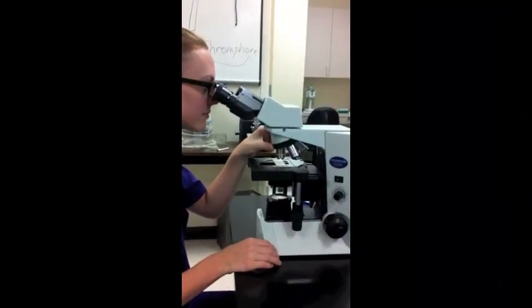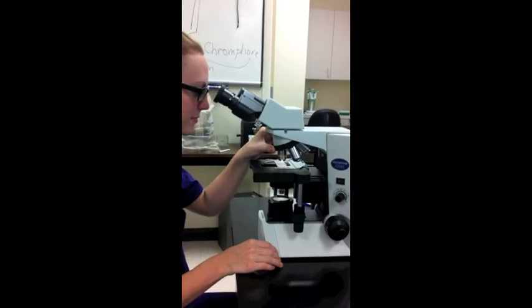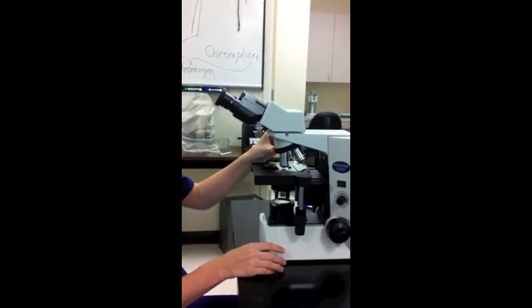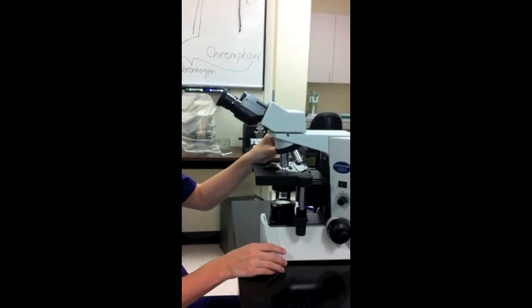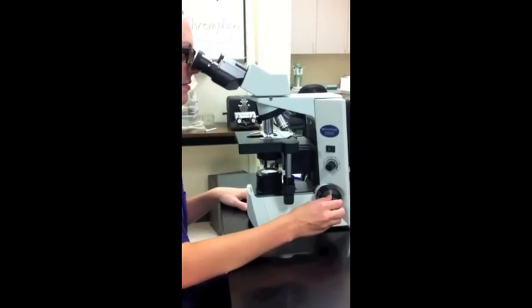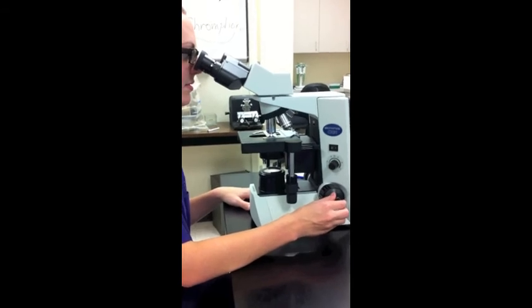Eleven, now rotate the 40X objective into place. Twelve, use the fine adjustment knobs to clearly focus your specimen.